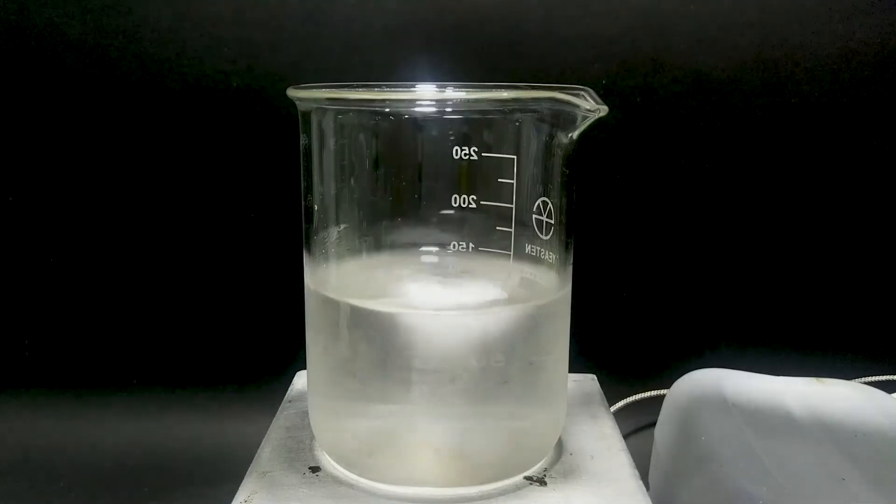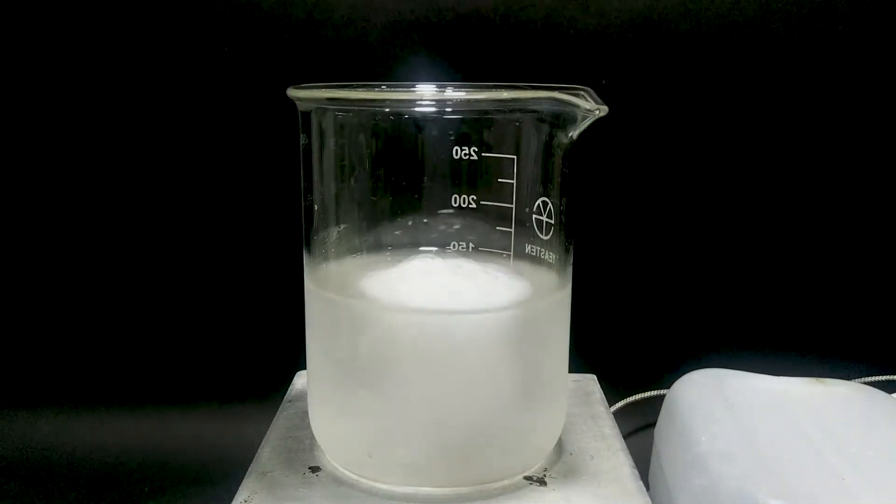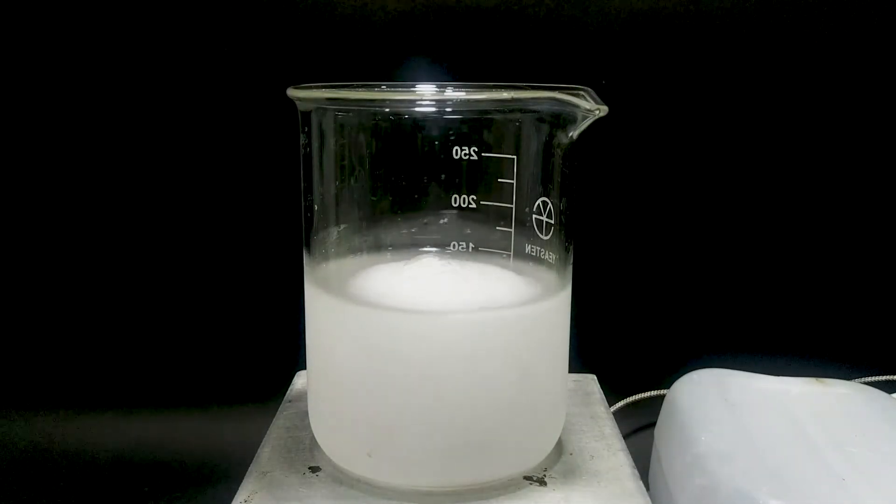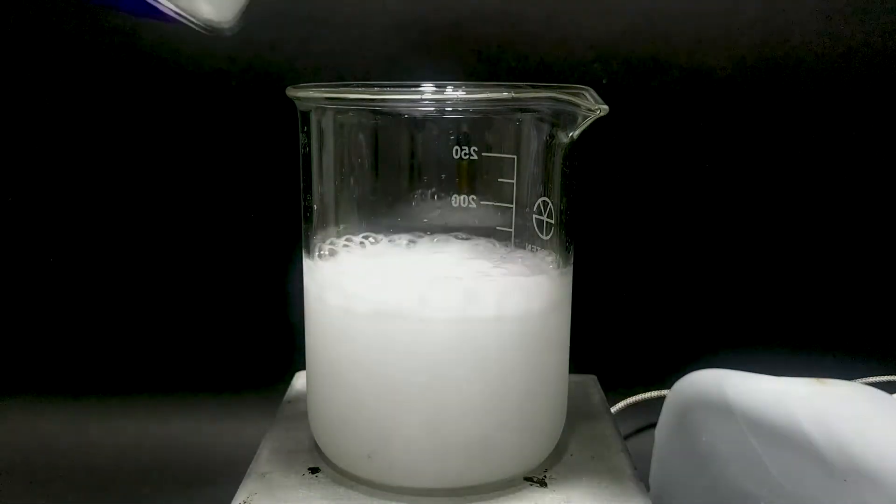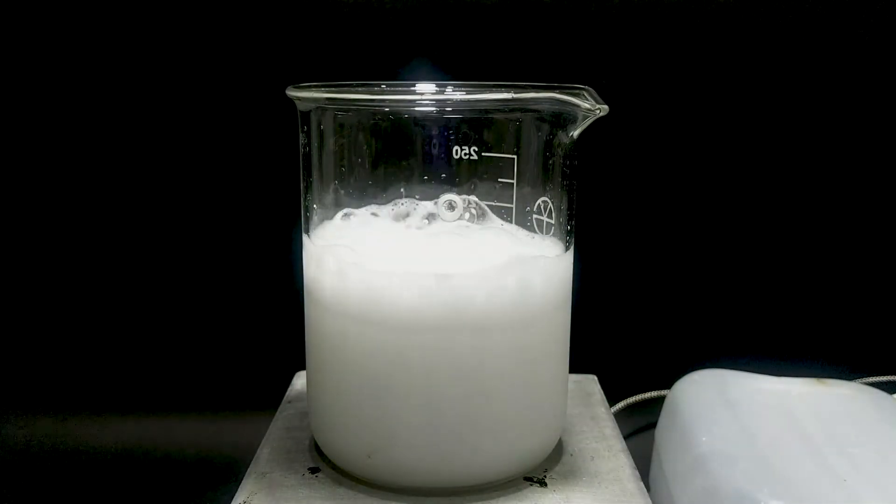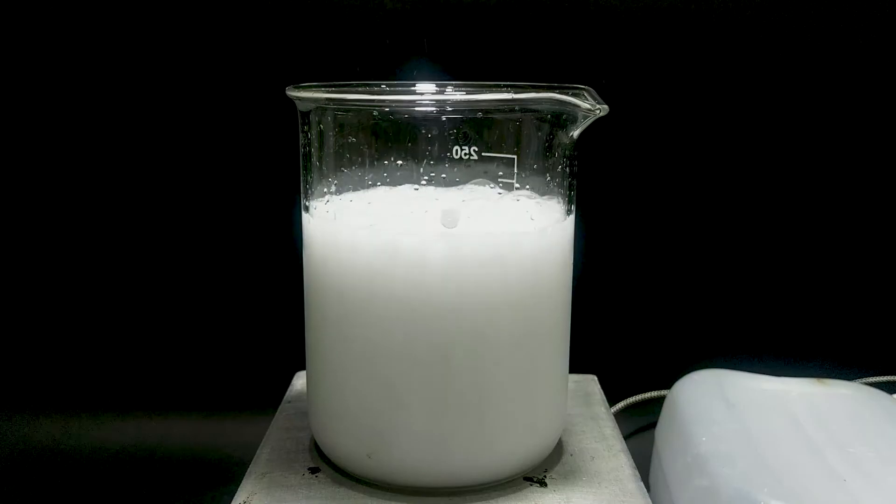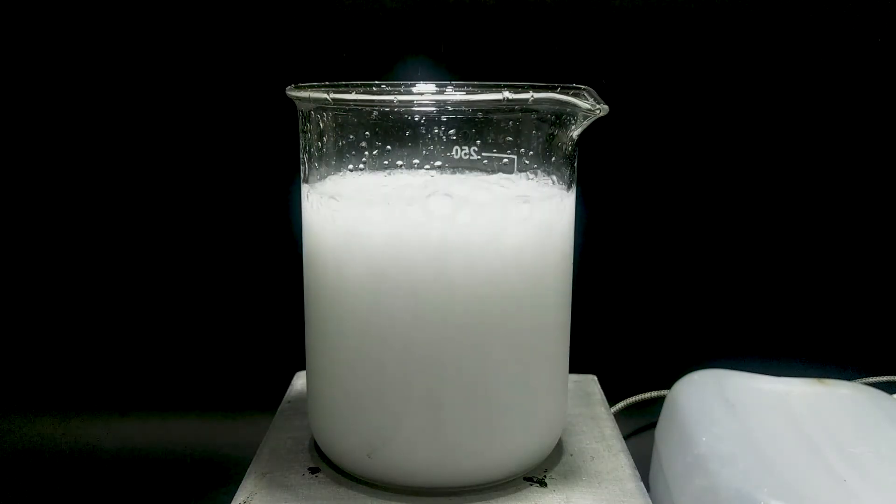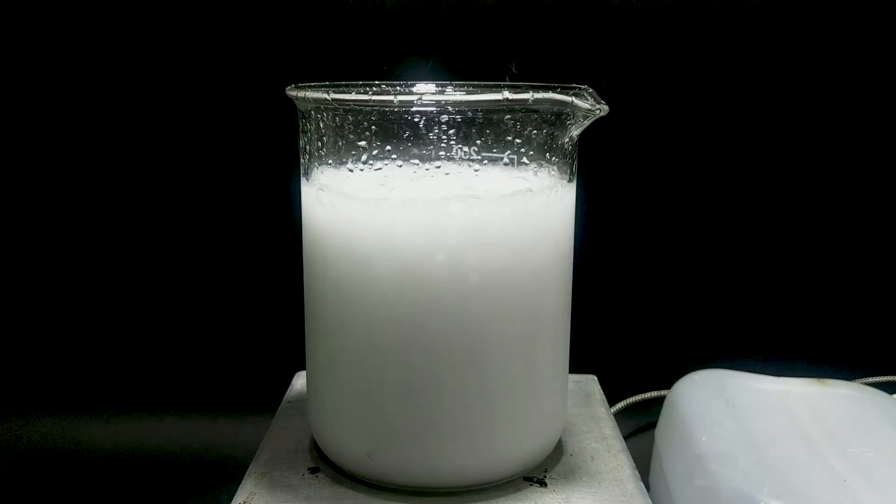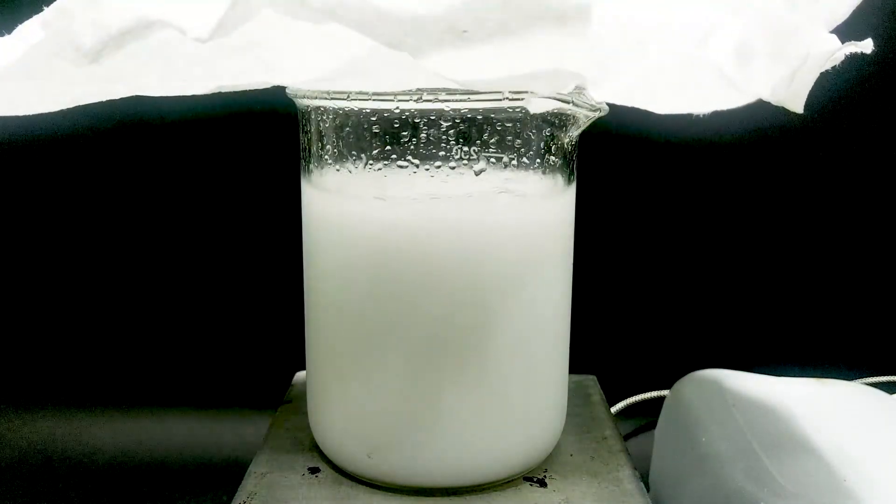Then prepare 35 grams of sodium carbonate and slowly dump them into the beaker. The moment it touches the solution, abundant bubbles form violently due to the release of CO2. This reaction is known as neutralization, where acid and base react together, forming salt and water.